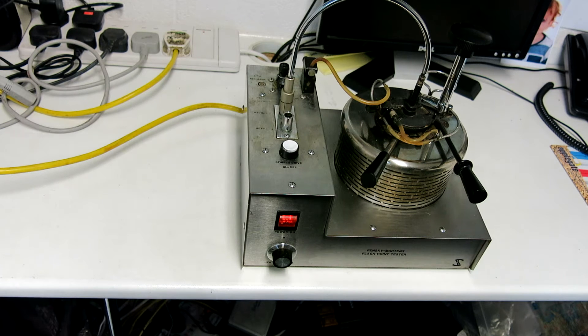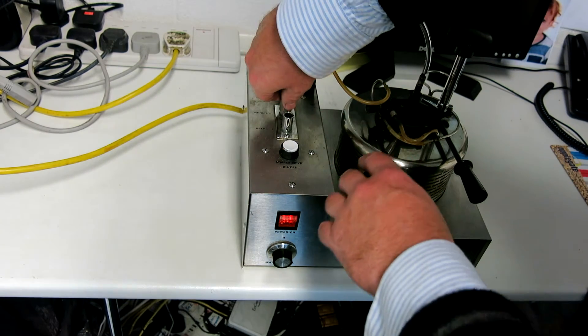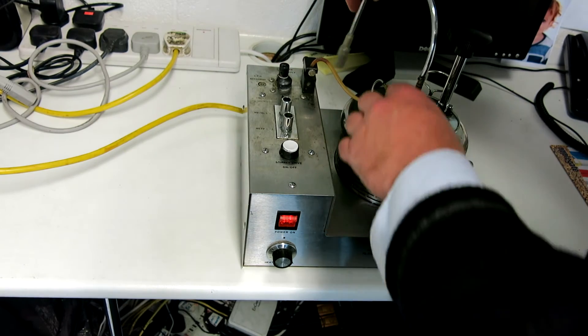Ideal for testing flashpoint basically in a lot of materials. So it's a standard test. What I'm now going to do is just dismantle the apparatus so you can actually see the individual parts. So the first thing I'll do is take this particular driver out of here like this.